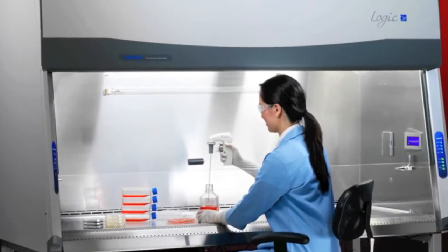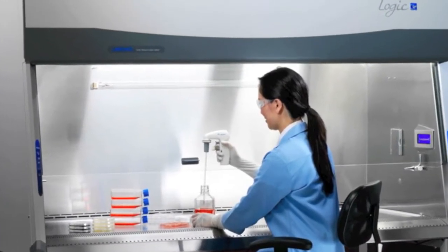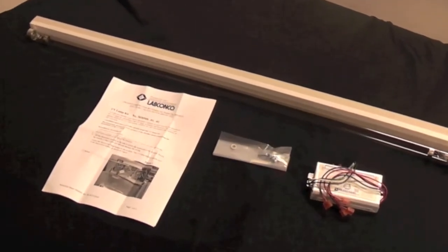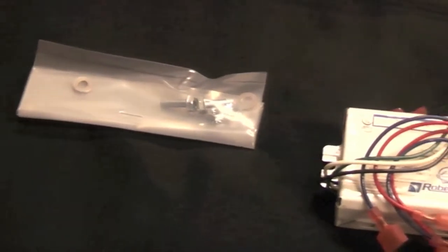All LabConco Purifier Logic series biosafety cabinets are pre-wired for the installation of a UV lamp kit, which consists of the UV lamp, its ballast, and fasteners. Note that a qualified electrician or certifier should install the UV lamp kit.